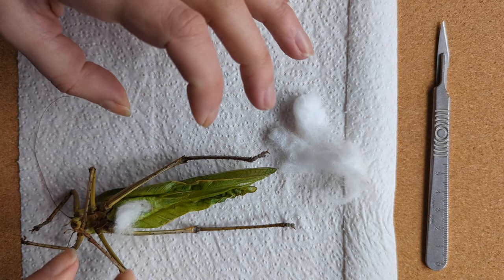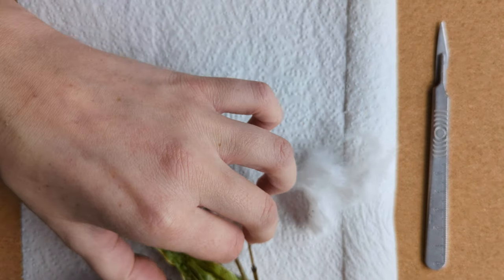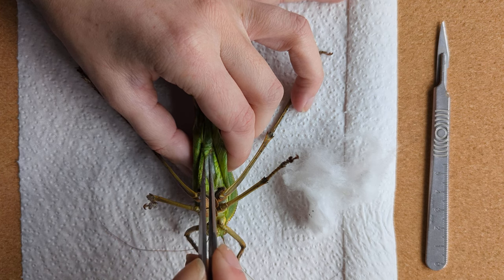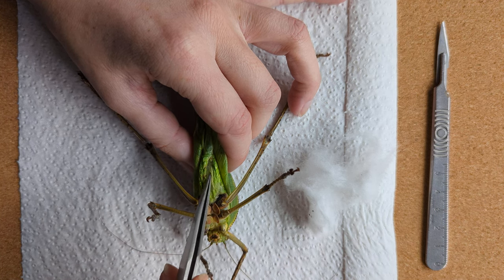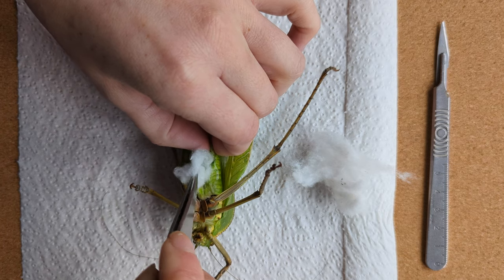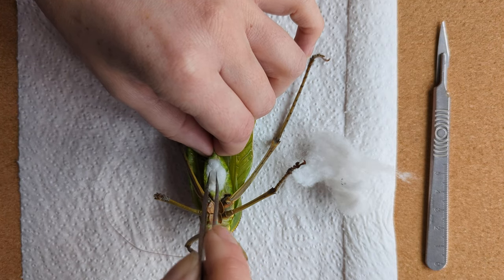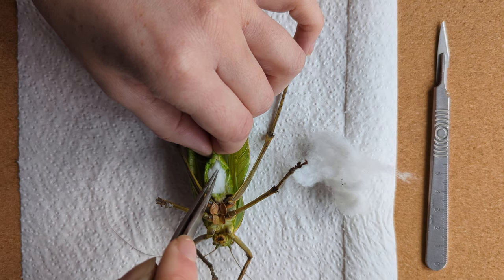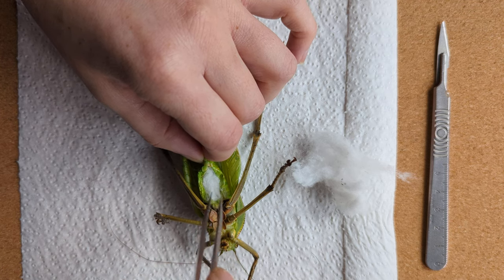This is why I use lots of small increments of cotton wool — I'm trying to reinflate the shape a bit at a time, rather than wrapping it around one entire pre-made form. If you're having trouble with this part, you can make the cotton wool damp with the isopropyl alcohol, which makes it a lot more pliable, and it reinflates itself once it's inside.